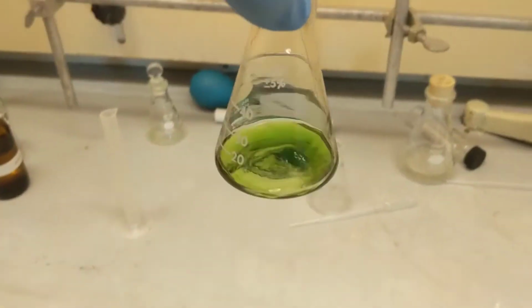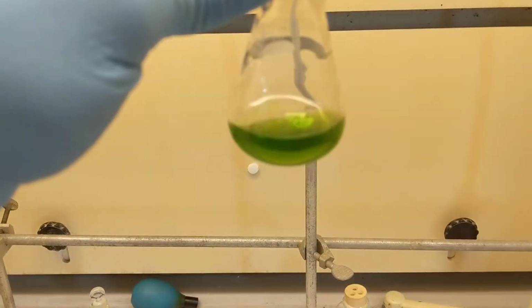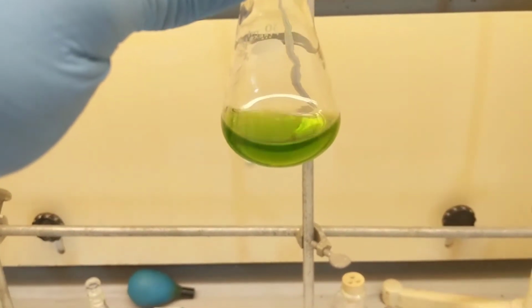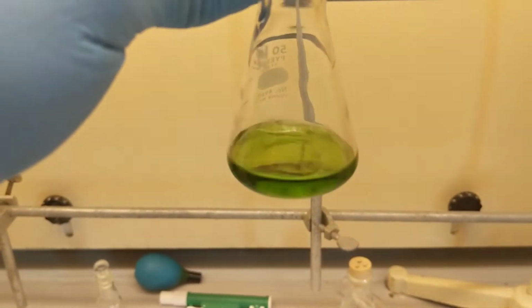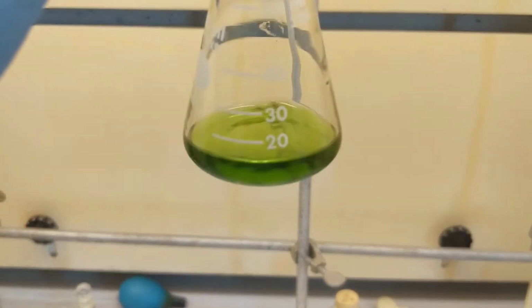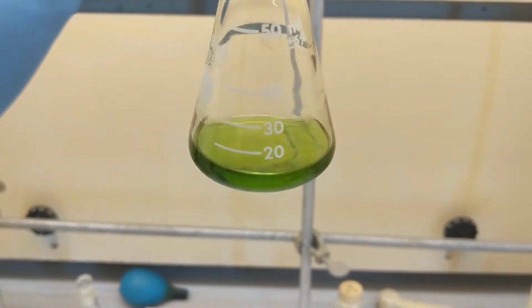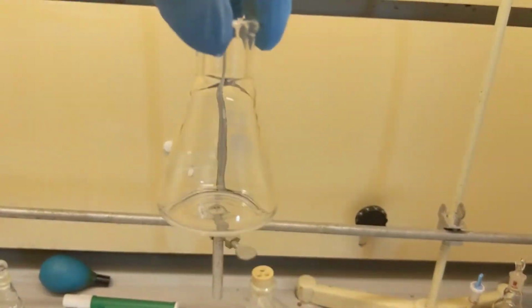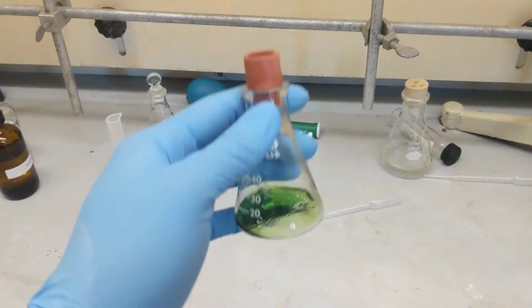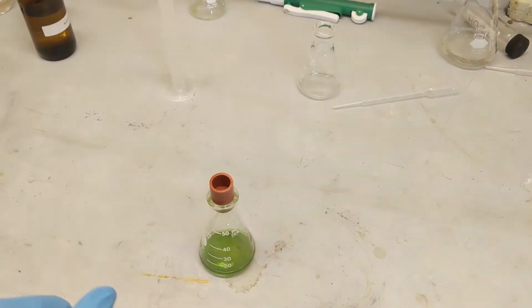Alright, this is the hexane layer after I pulled out the aqueous and poured this out the top. You can see it's a nice color of green. It's kind of a green yellow, which we'd expect since there are both chlorophylls and carotenoids in there. So I'm gonna dry this to make sure there's no water. And then I'm gonna extract it, put it into a clean Erlenmeyer, evaporate off my hexane to get the dry concentration, and then add just half a milliliter of hexane.